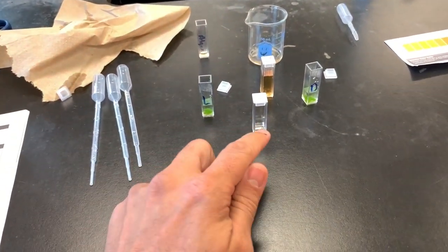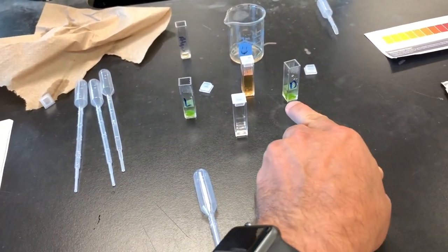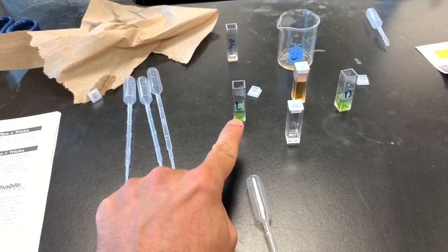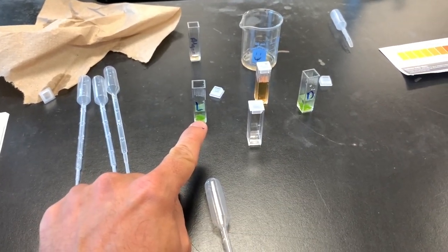So you can see I have transferred one milliliter of distilled water into the light one, and one milliliter of distilled water into the dark one. What we're going to do is let the old CO2 solution that it was in wash out into this water. After five minutes, you're going to then take a new pipette.